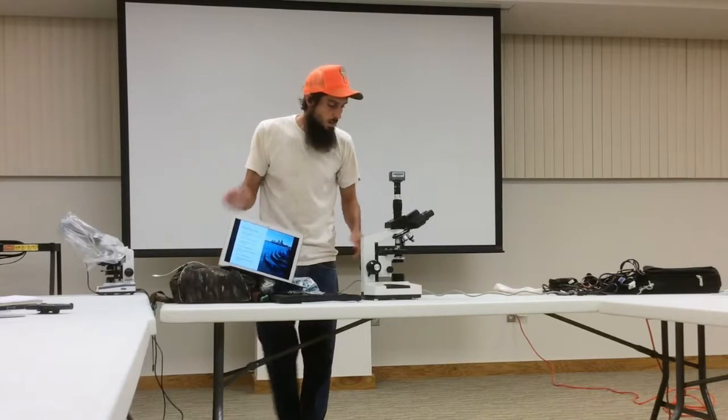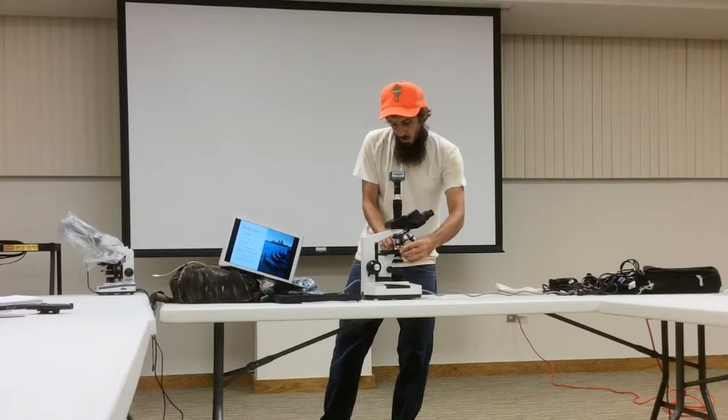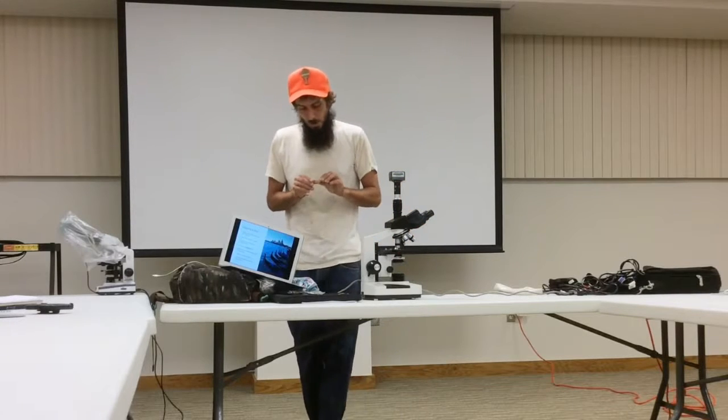After I have my microscope, the next thing I wanted to go over is preparing a slide.